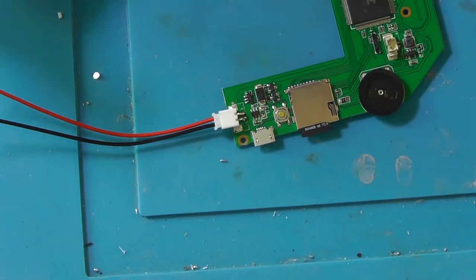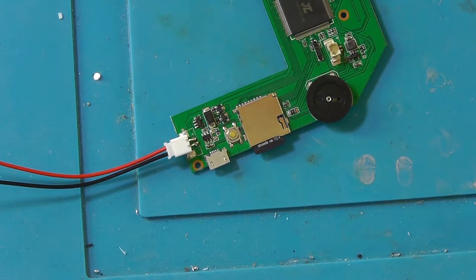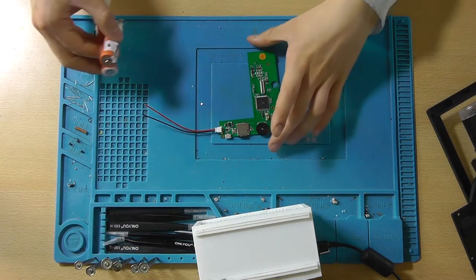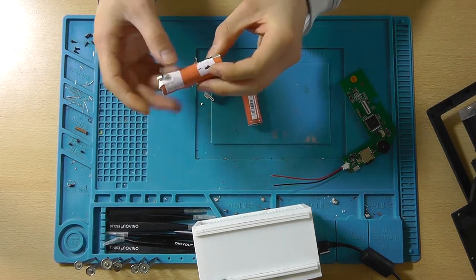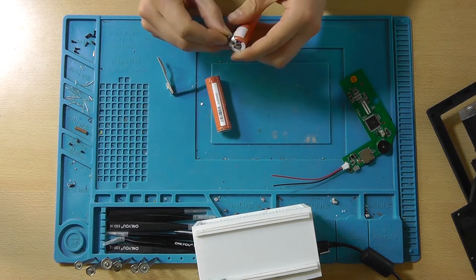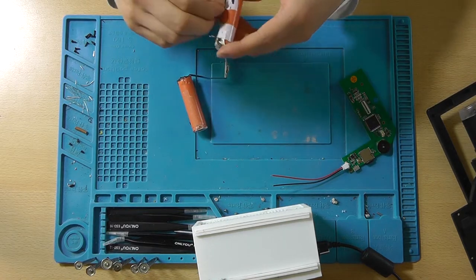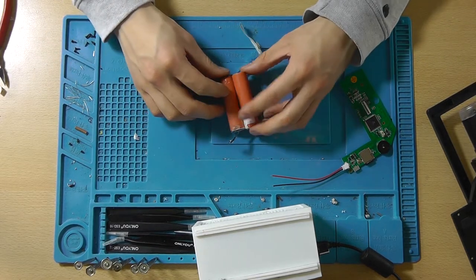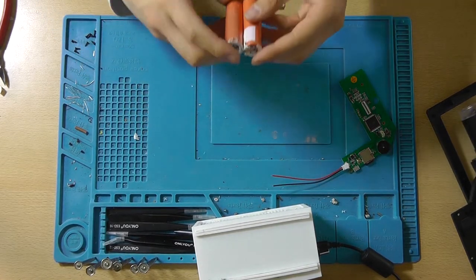Now, let's glue this in place before it gets loose again. So whilst the glue gun is heating up, we're going to prepare the batteries. Now these are regular 18650s, recycled from laptop batteries. And we'll put them in parallel to get more capacity out of them. Alright, so I'm going to connect it like this, which should work fine.